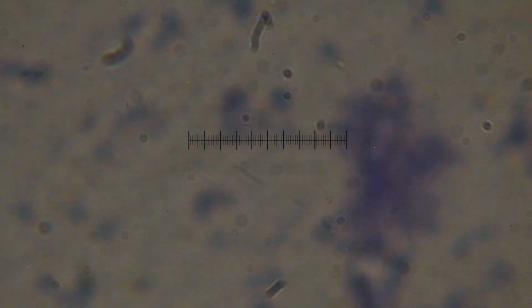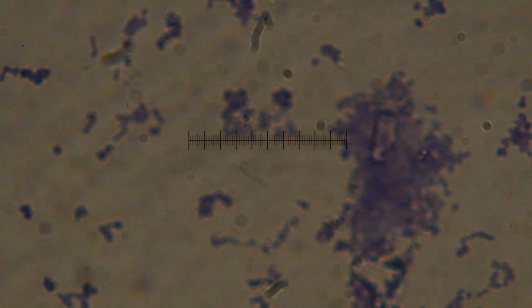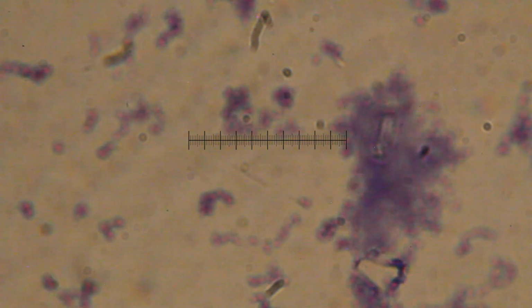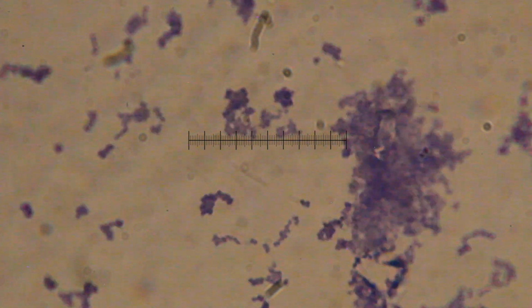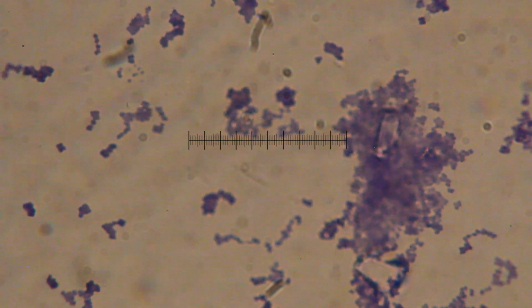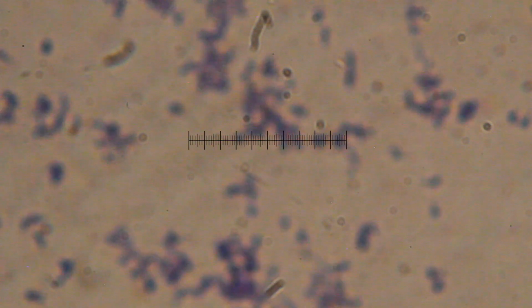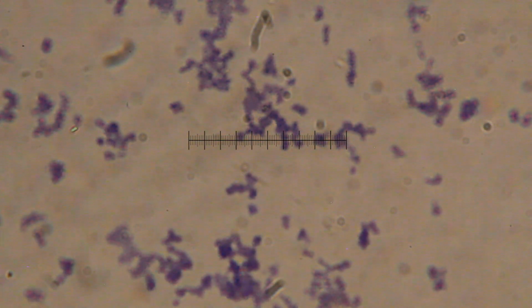We'll swing in our 100x, refocus, increase that light so we can increase that resolution so we can see these. And these are nice and easy to see as well. So we can see those arrangements, and you can see those shapes in there on these guys.